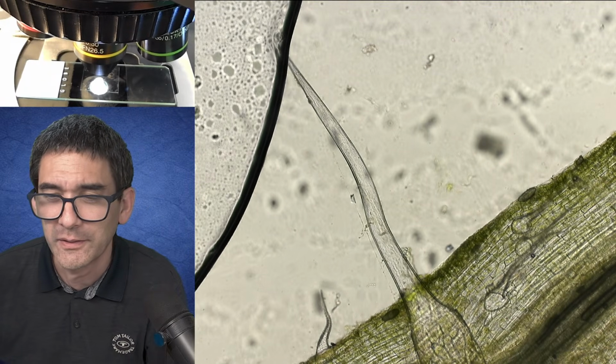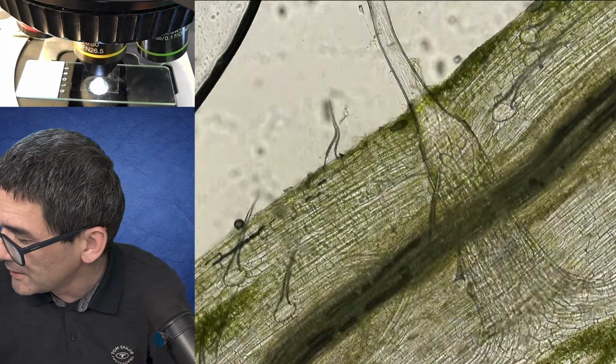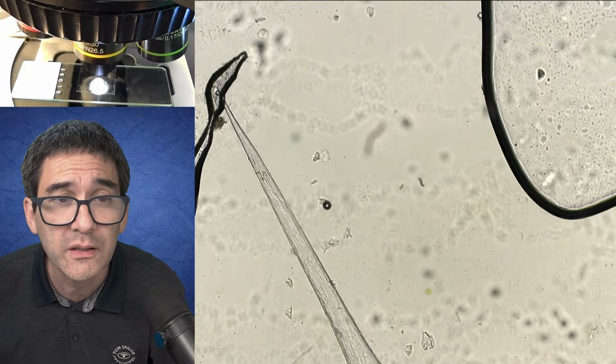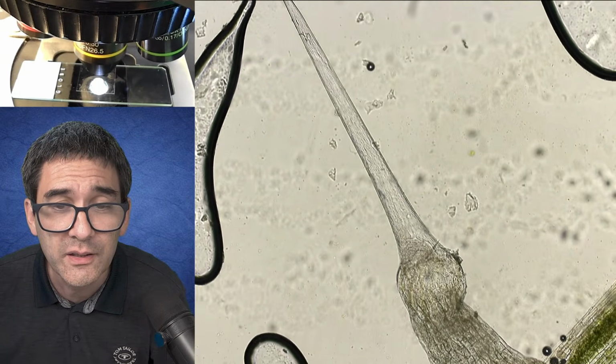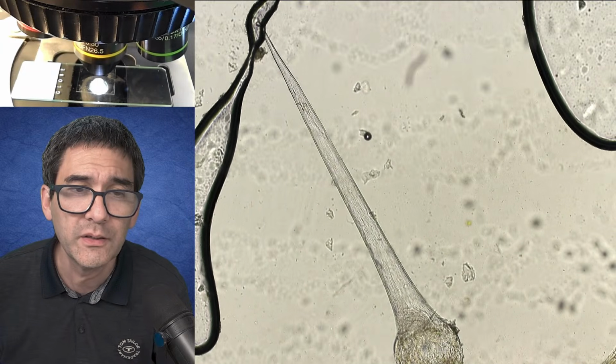You see, there is a little bit of a, yeah, over here. Let's see if there's another one over here. This one is actually quite nice. It came off here, right? So yeah, and here it is. One of those.